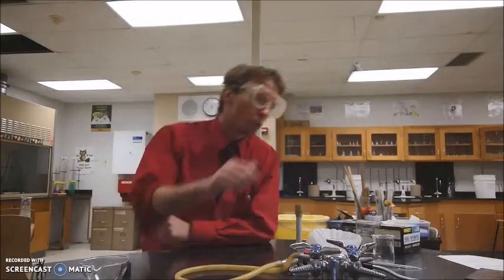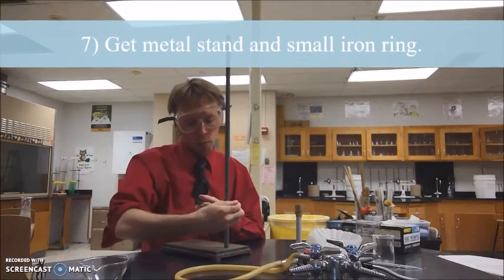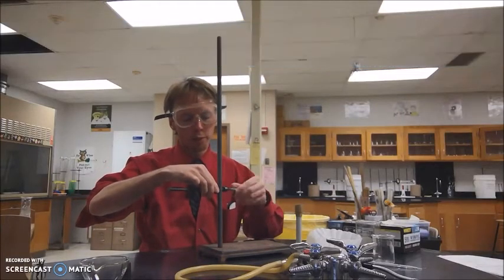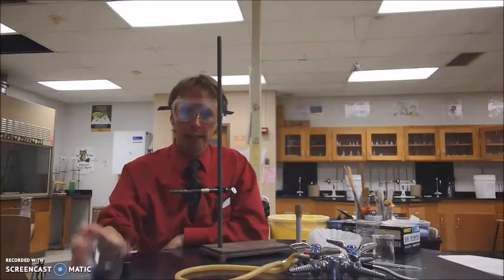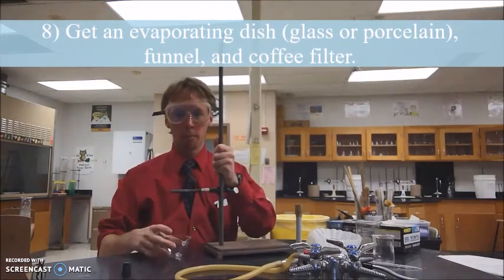To do this, you're going to get a metal stand with a small iron ring attached to it. The only reason for this is that the filtration process can take a long time. So rather than having you hold the materials, you'll have this do the holding for you. You're going to take an evaporating dish, either made of glass or made of white porcelain. I'm going to put that underneath.